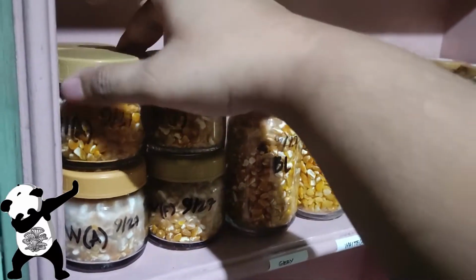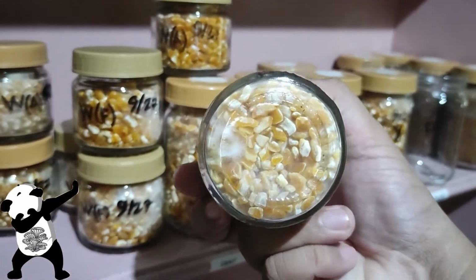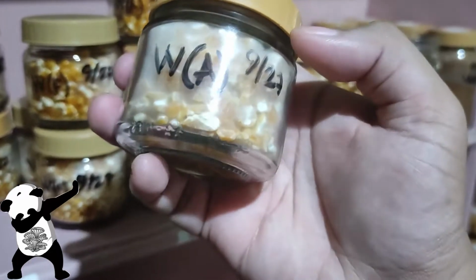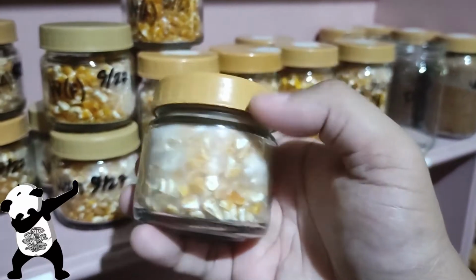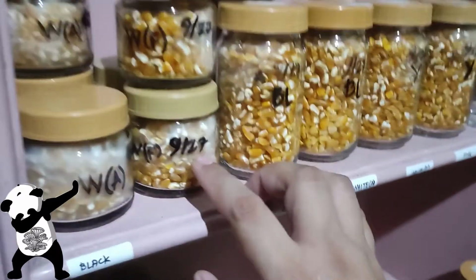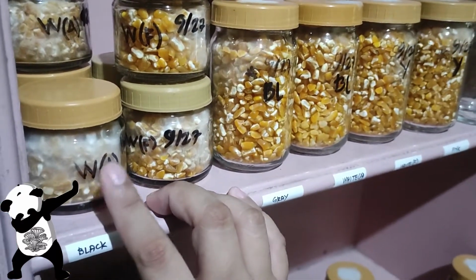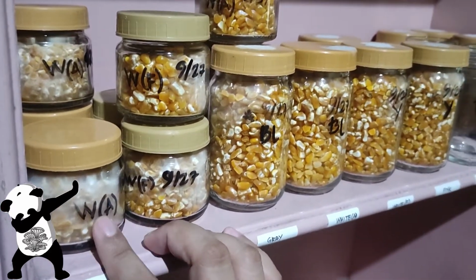As you can see, there are grains that are already colonizing even the bottom. So this mycelium is actually vigorous, and I don't think that this is what you call the cotton contamination. It's actually mycelium. It's even like this. You see that? Later on it's going to be really white, and what you want to do to double-check is the smell of your mycelium.